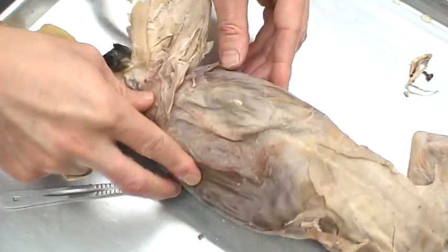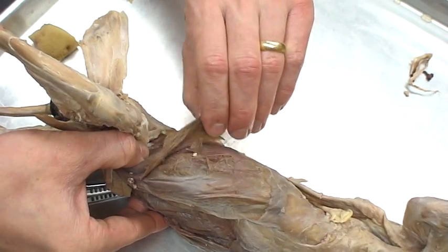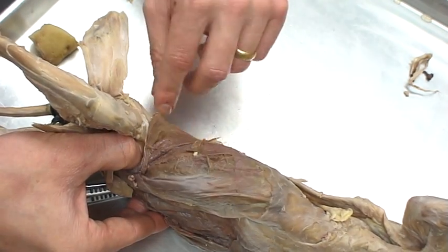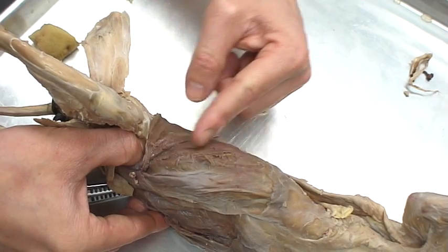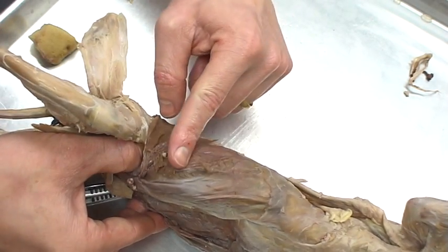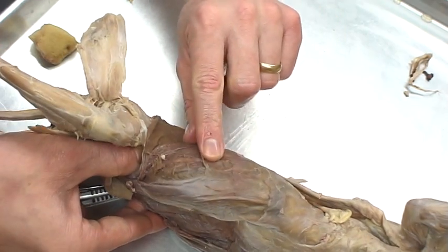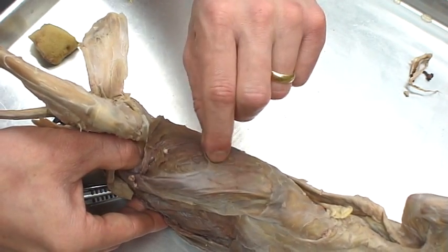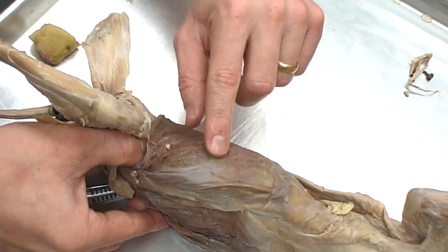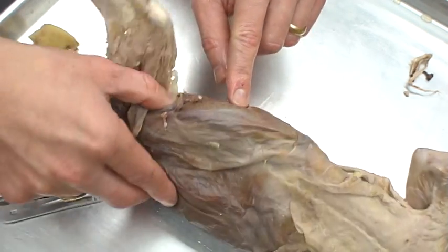I lift that up. Now this side actually got torn up a little bit, ruptured somehow, so I pulled one away here. We can see that the grain of this actually runs downward — this is going to be the internal abdominal oblique. I can peel that back away. I cleaned that out just a little bit to show you that these go straight across, and that's going to be the transversus abdominis.